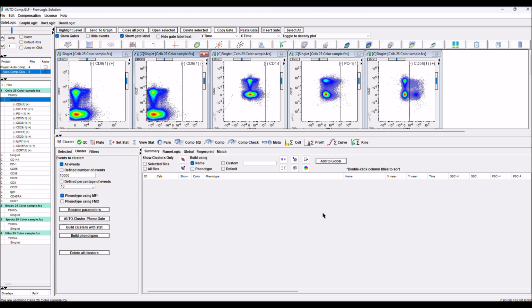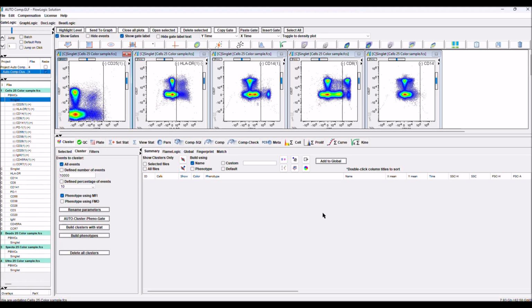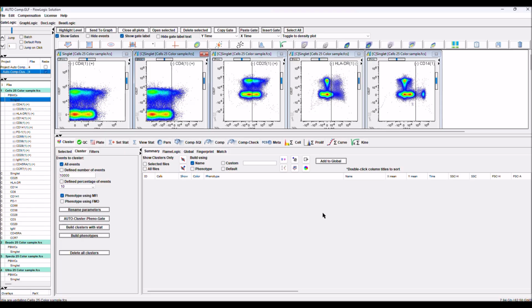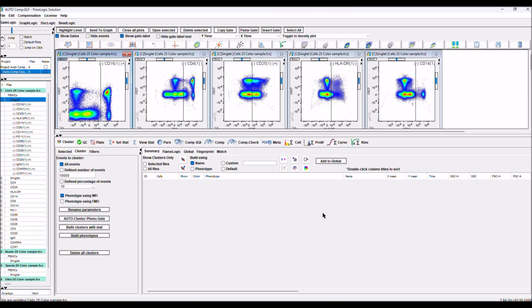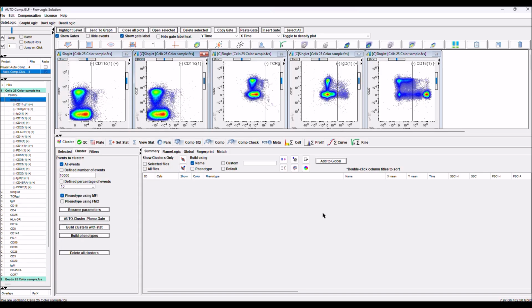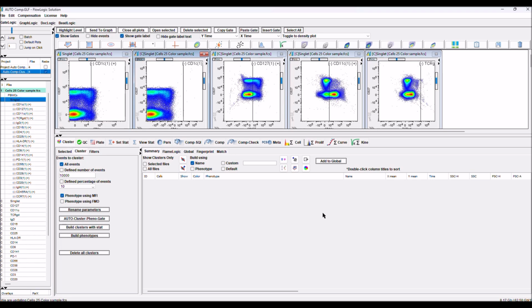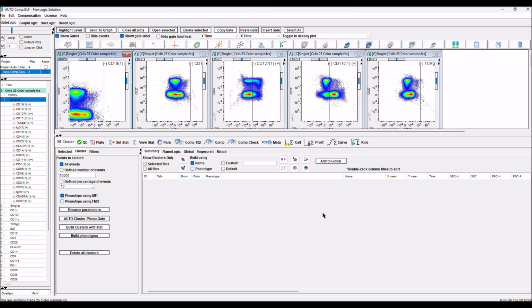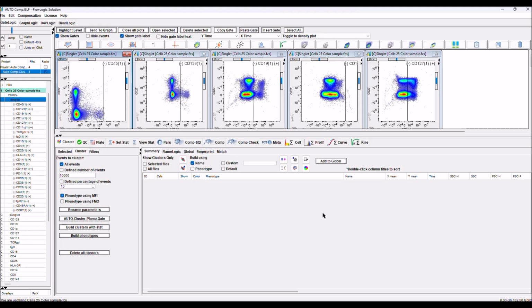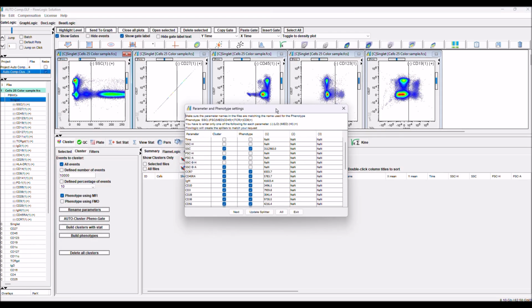If you have a binary distribution, it will be very easy for FlowLogic to identify positive and negative. If not, if the distribution is more complex, FlowLogic will try to do as much as it can, and then you have to go through and eventually adjust the position of the splitter. So you have to identify where the positive and negative should be. Now FlowLogic has finished the process. It's coming with this pop-up with the table.